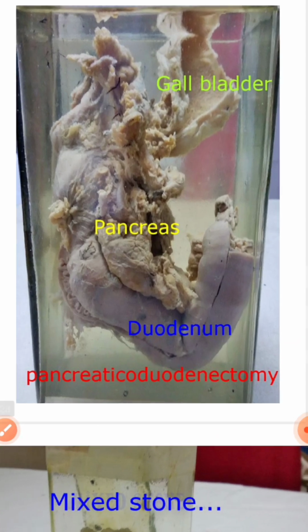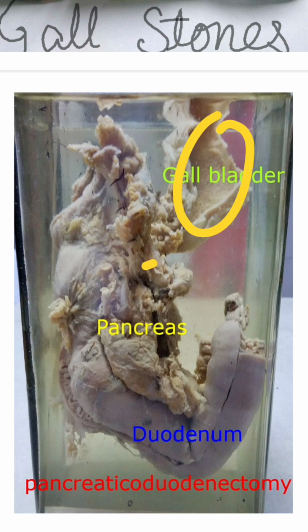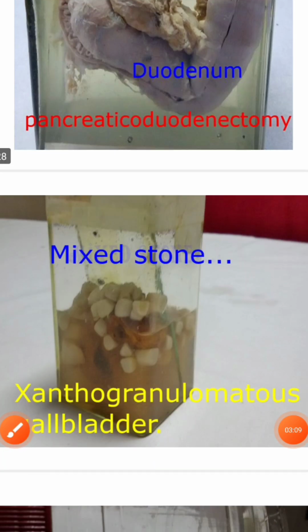Another one here, this is a pancreaticoduodenectomy. This one is just an extra thing you should know. Here is the gallbladder, here the pancreas head, and here the duodenum. Most commonly this is the Whipple procedure. They will remove the gallbladder, head of the pancreas, and duodenum, and do a triple anastomosis. Then mixed stones, cholesterol stones.